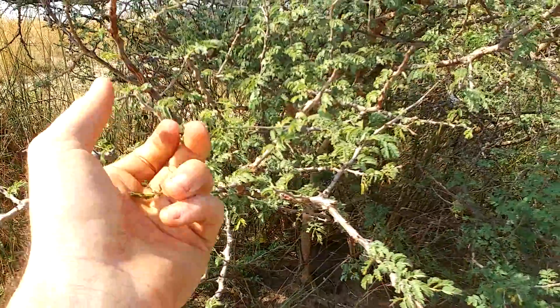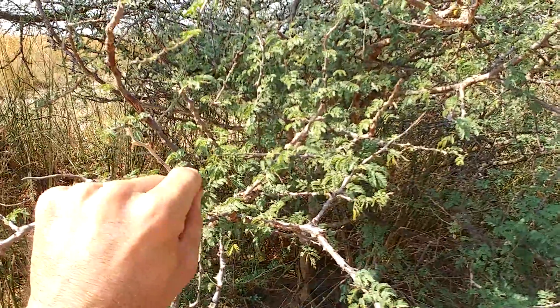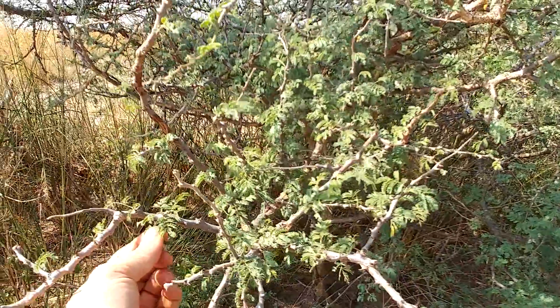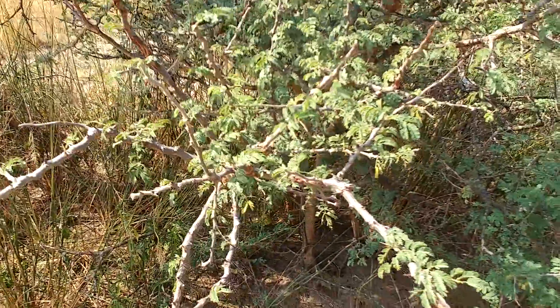So we're out here collecting leaf samples of Acacia senegal for nutritional and chemical analyses. When you collect leaf samples of Acacia senegal, you quickly learn to appreciate the skill and dexterity of giraffe tongues and giraffe lips in navigating these heavily defended plants.